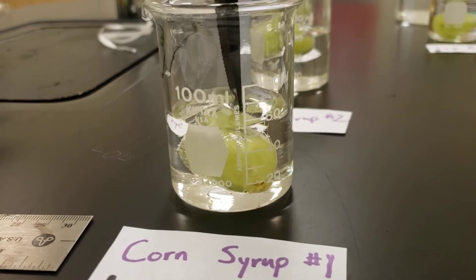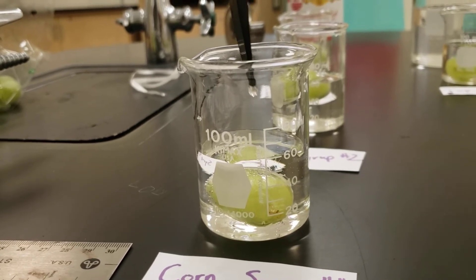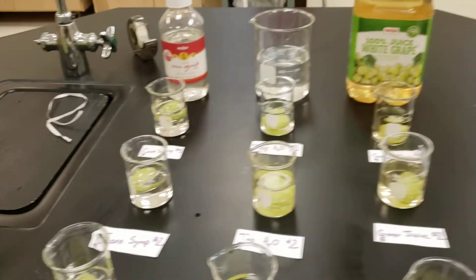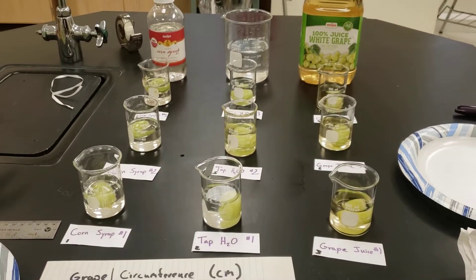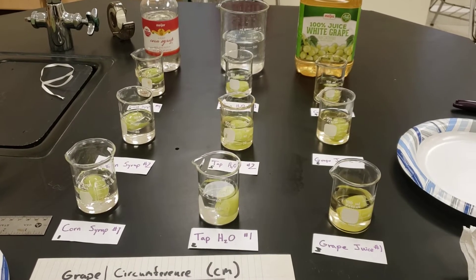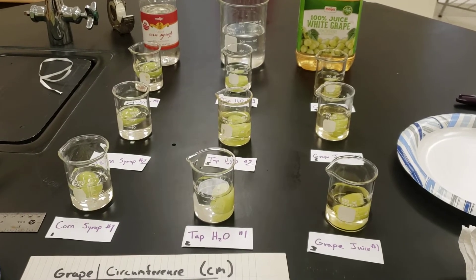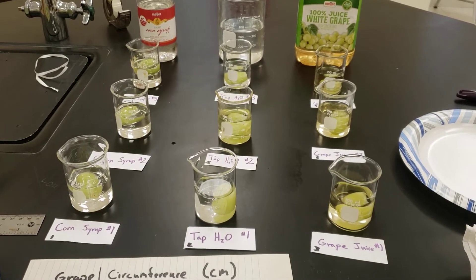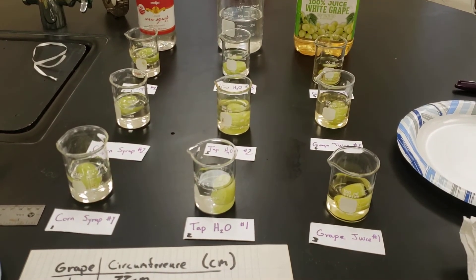We've got the grape submerged all around and that should work. Now we're going to let this sit for 24 hours and then measure again. What we want you to do right now is predict what is going to happen to each grape — in the corn syrup, in the tap water, and in the grape juice. Predict whether the grape size is going to stay the same, get bigger, or get smaller. We will test your hypotheses in 24 hours.